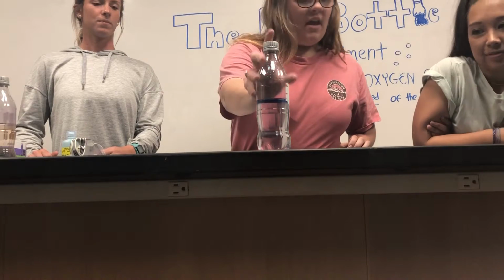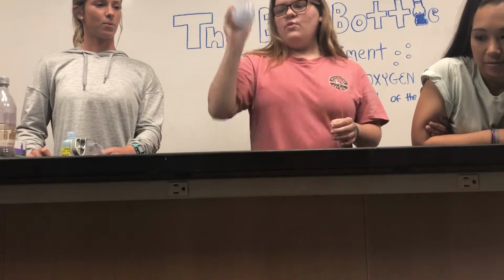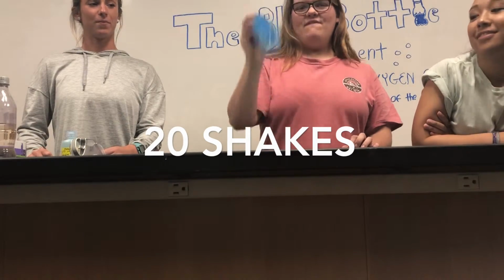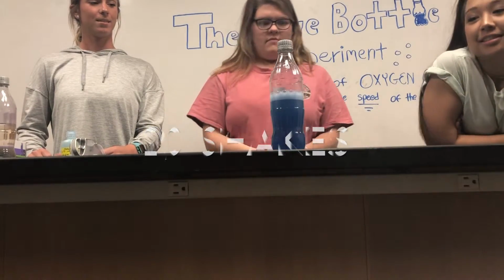So now we're going to do it one more time, and we're going to shake it about 20 times, so quite a few times. 2, 3, 4, 5, 6, 7, 8, 9, 10, 11, 12, 13, 14, 15, 16, 17, 18, 19, 20. We're going to start the timer one more time.